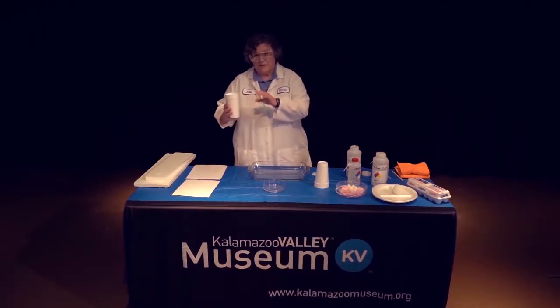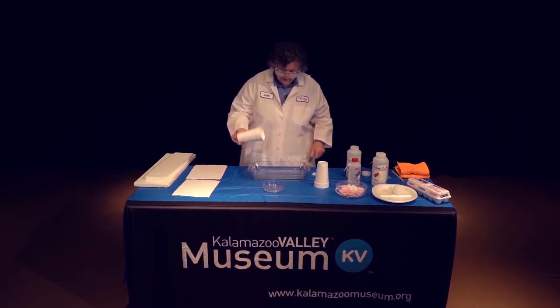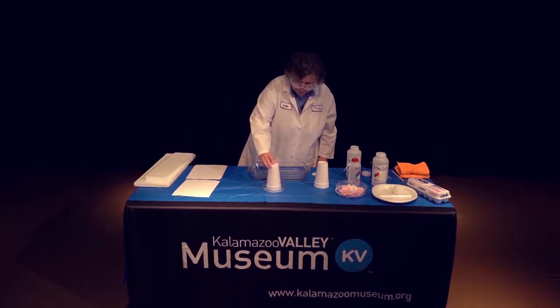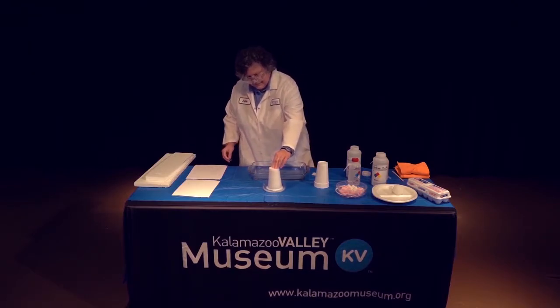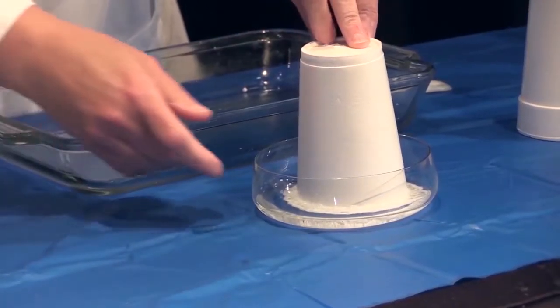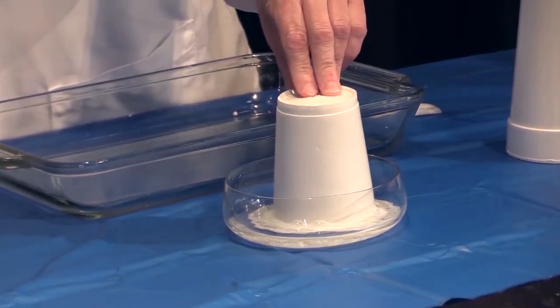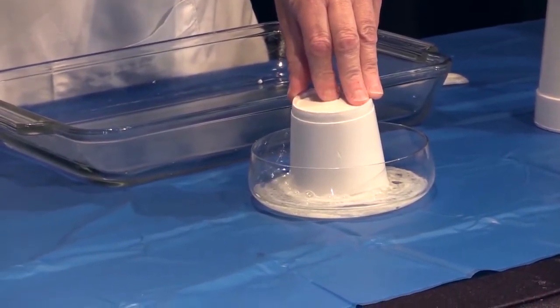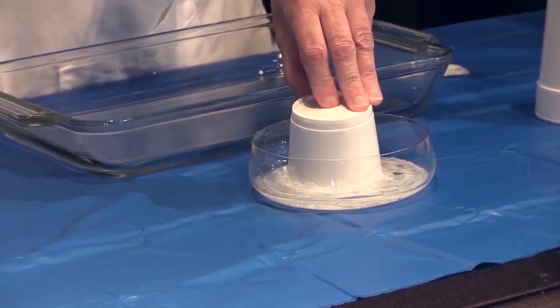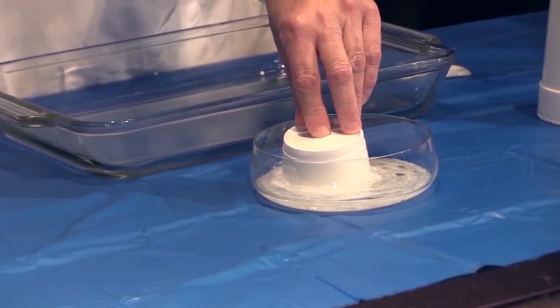So I remember I said polystyrene and the rest is air, a little bit of white coat coloring. So we'll put it into this thing here and we'll dissolve it, and you may be able to see that there's a white goop forming in there. And that's just dissolving that Styrofoam right into the liquid.